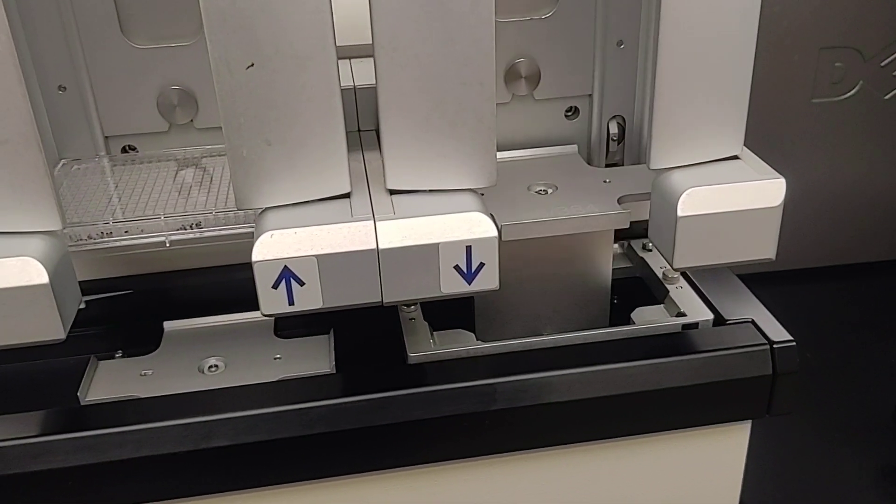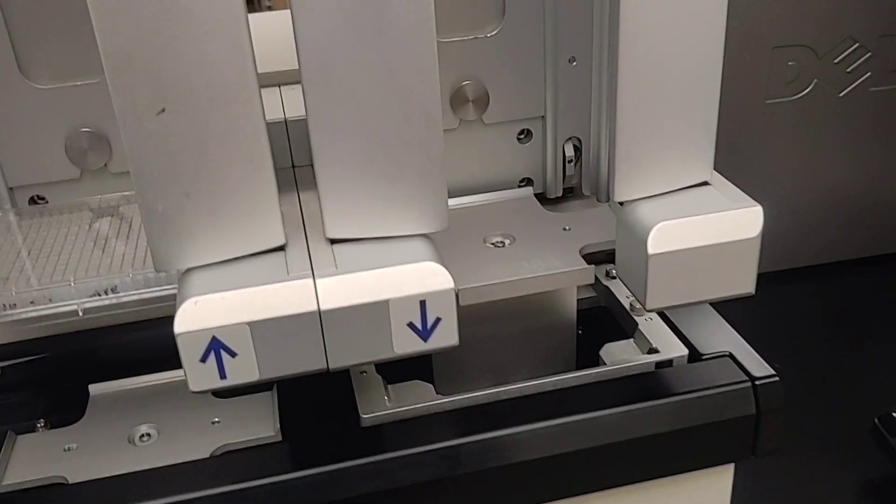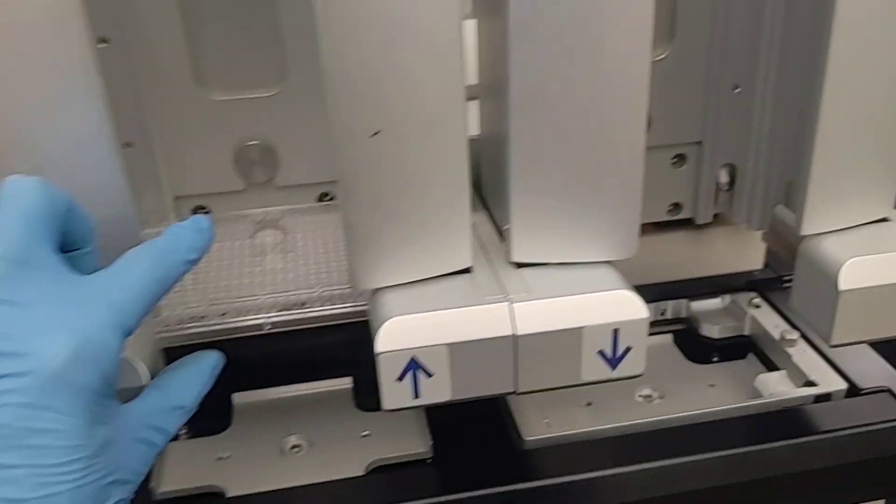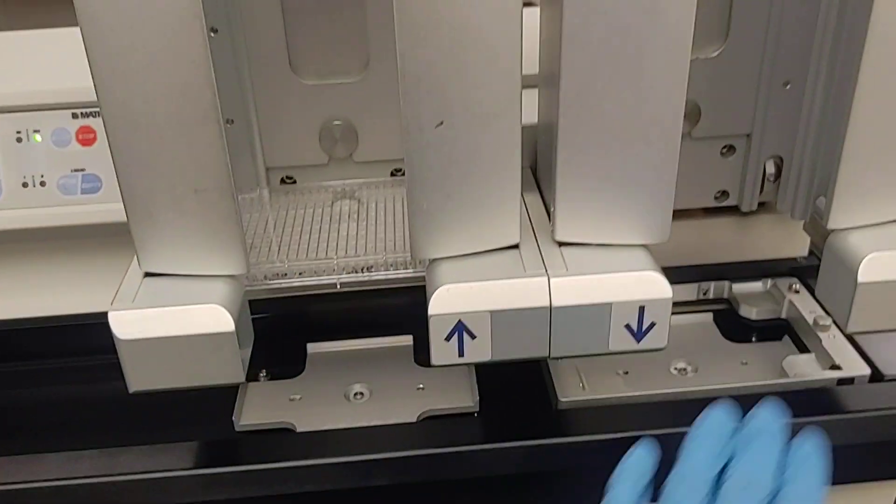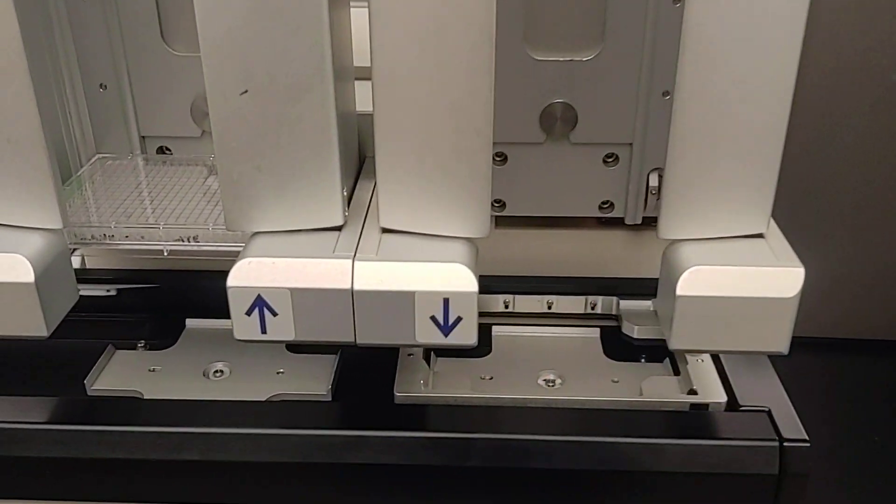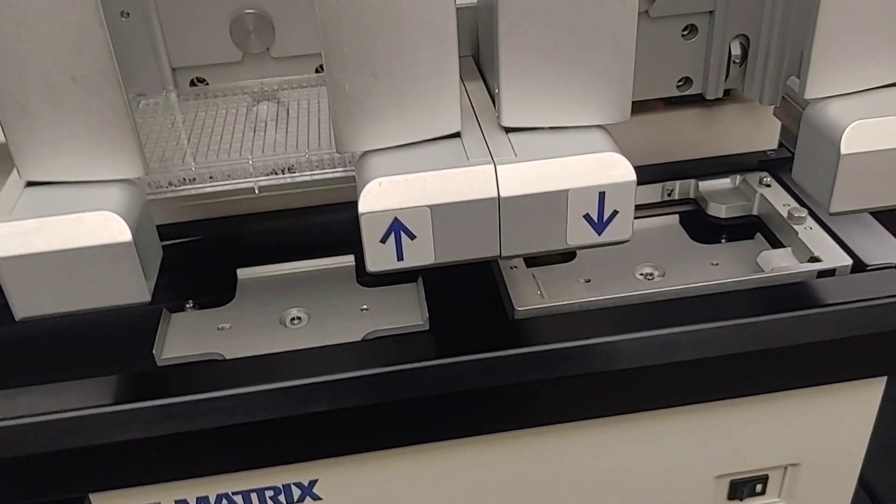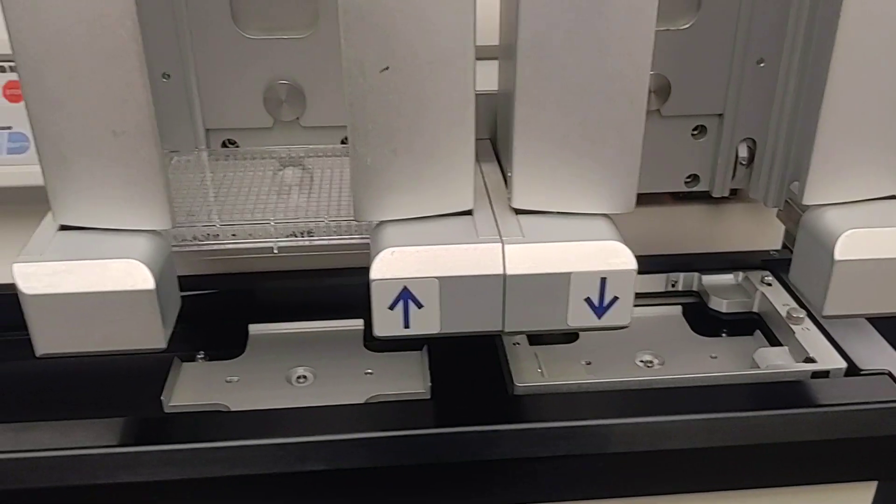And then it's going to go over there to get the next plate. So you can imagine how after a sequence of plates, they're going to be in a different order. If we had the restack on, then it would just move them all back to the original position so that they're in the same sequence.